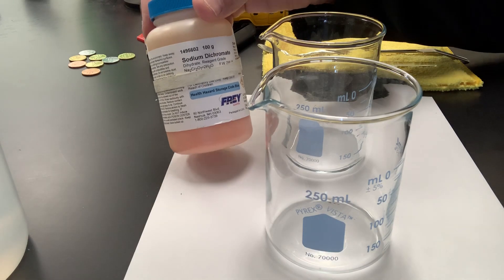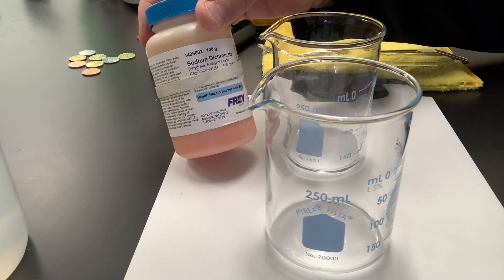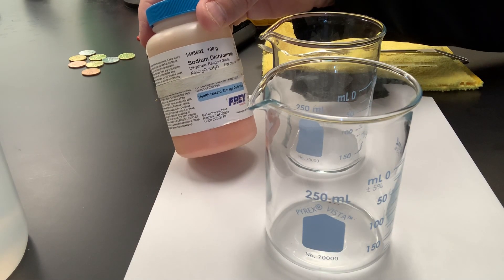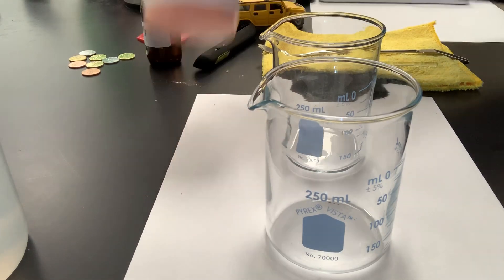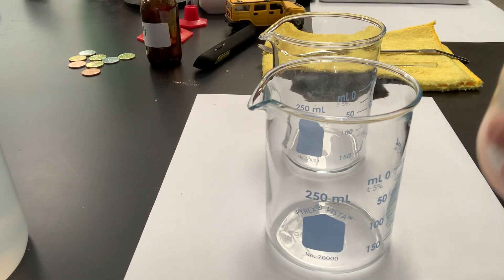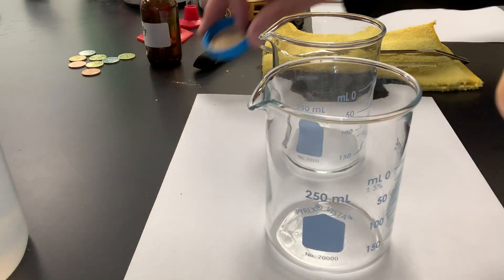what a homogenous mixture is, and what a heterogeneous mixture is. In addition to that, I want to show you something called the Tyndall effect. So, a whole bunch of stuff we need to talk about today. So, I have a pure compound here. Remember, compounds are considered pure. This is sodium dichromate. It's sodium, chromium, and oxygen atoms, all chemically bonded to each other. It's a pretty orange color salt.